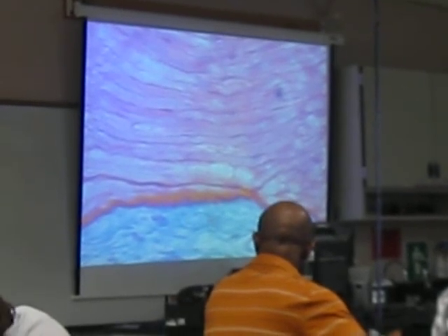So you can see the axons, parts of the axons, you see the myelin sheath. You can even see some of the Schwann cell nuclei, these dark spots spread throughout. And then you've got the neurofibril nodes. Now if we go to the outer edge of this section, you'll also be able to see the perineurium and the epineurium. There's some other things that you'll be able to see or identify on the slides.